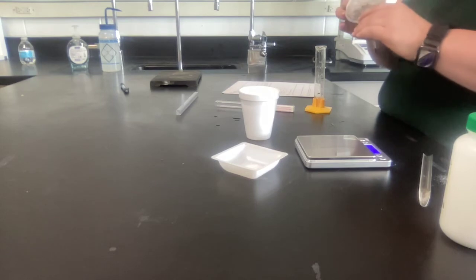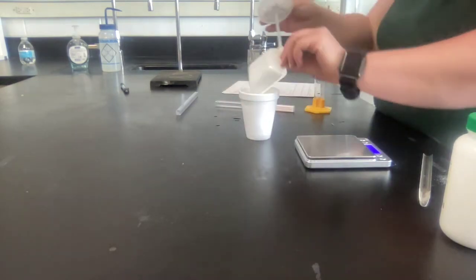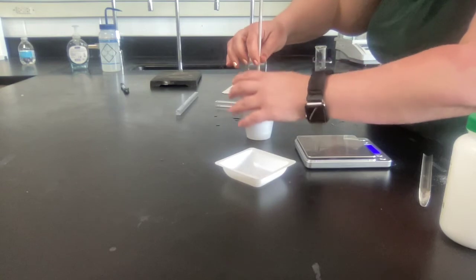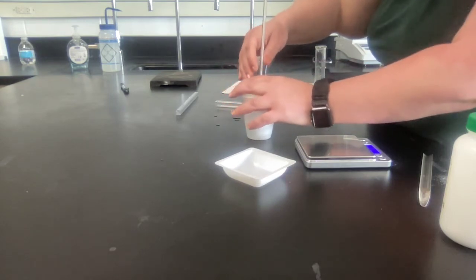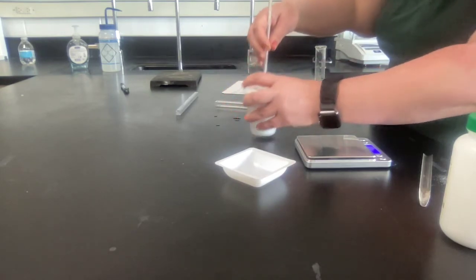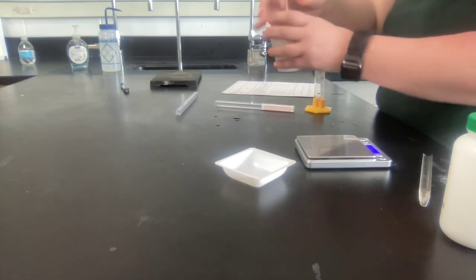So at that point, you can take your ammonium chloride, pour it in, put the thermometer in, and close the cover. You can stir it.